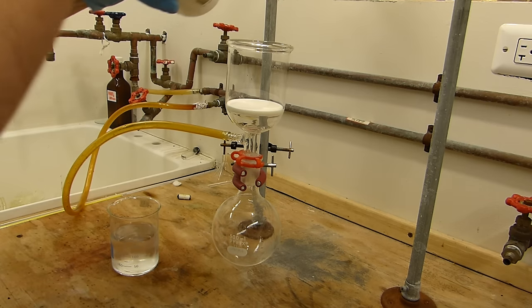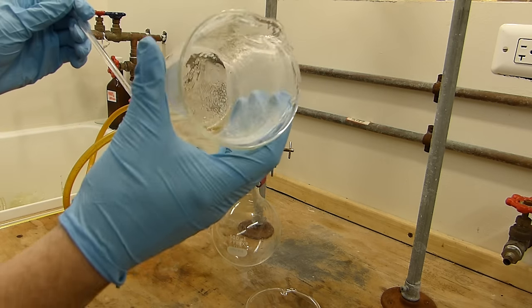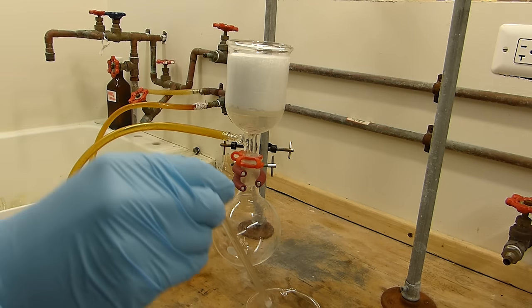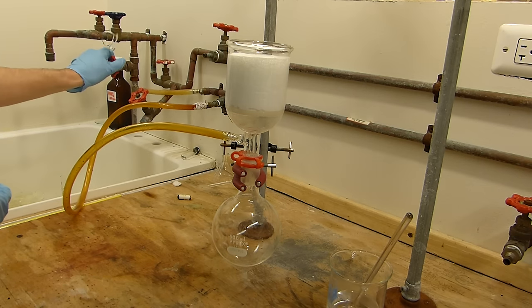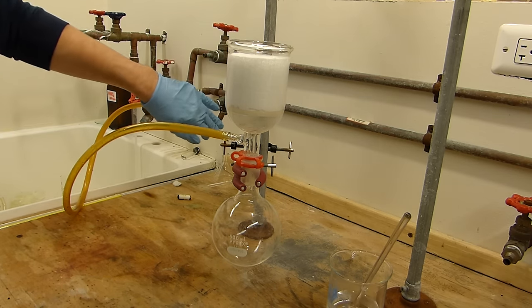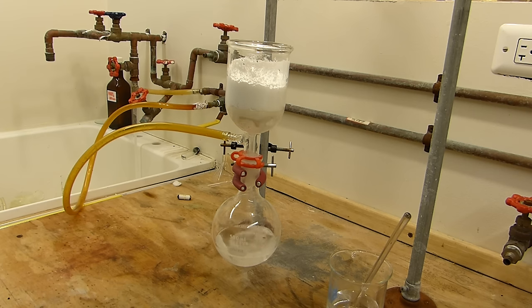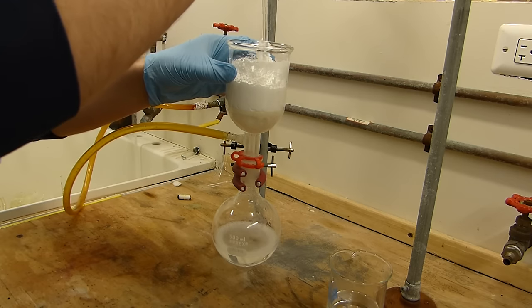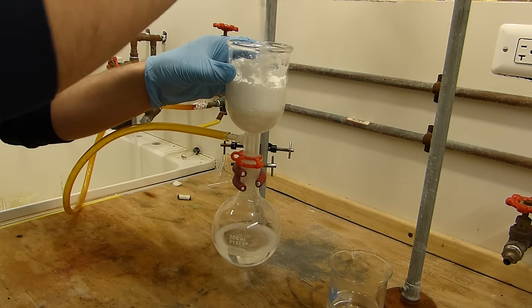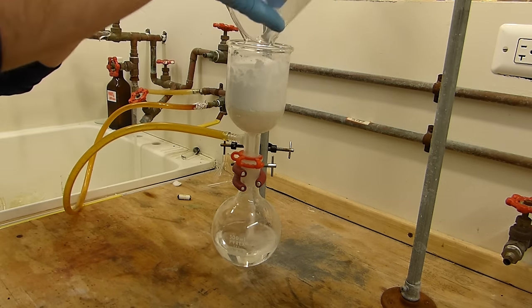So we can go ahead and pour this into the filter funnel. It's about as good as it needs to be. And I'll turn on the vacuum and we will get this thing filtering. There we go.